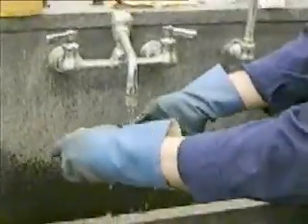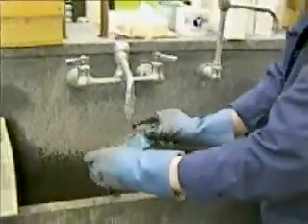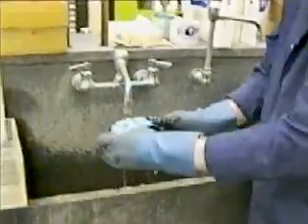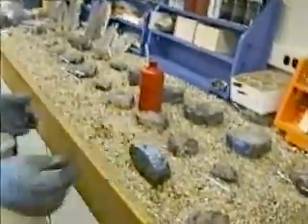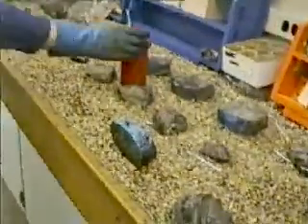The block is placed in a gravel bed where it is washed with a stream of acetone. The process may be repeated, and upon drying the cut and etched surface takes on a whitish appearance.